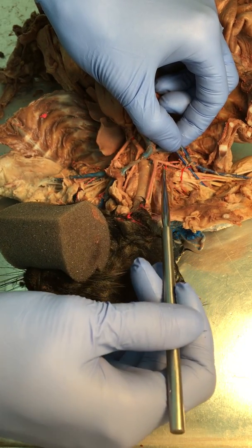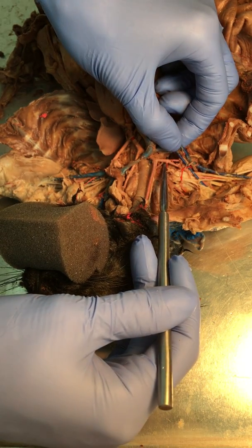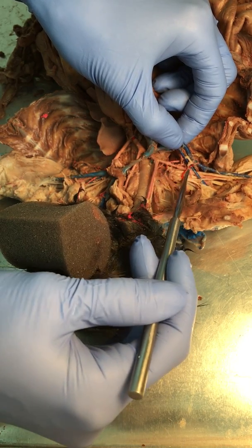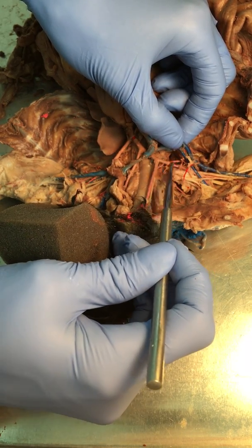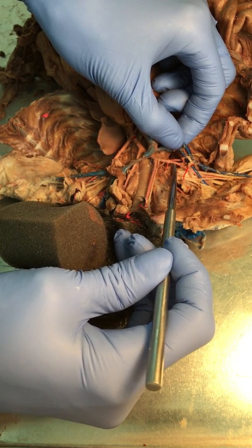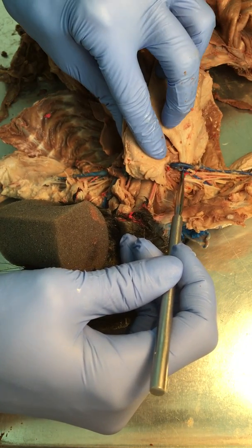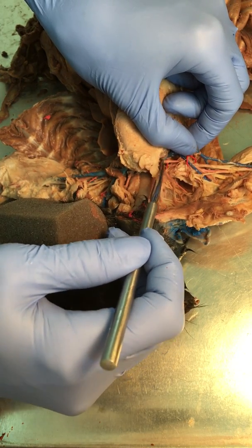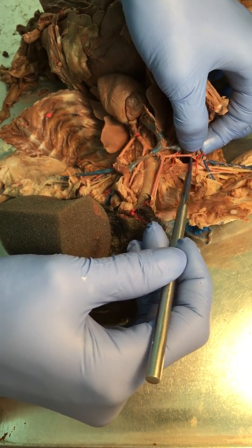So something to remember with the vessels going into the arm is you're going to have different boundaries that are going to change the name as they go along. So it's like you're driving down a street and you're in the city and you go to county and all of a sudden the road changes names. It's kind of the same thing that's happening here. So right under the clavicle, while you're still kind of in the thoracic cavity, you have the subclavian. And then once you cross over, if I was to close this like this, once you would cross over out of the thoracic cavity right here, you would end up in the axillary region.